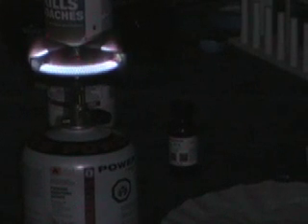Now I'm going to put it in the hydrochloric acid again. And let's try this again. Here we go. Yeah, that's a nice green tint. I think it shows up on camera, probably.